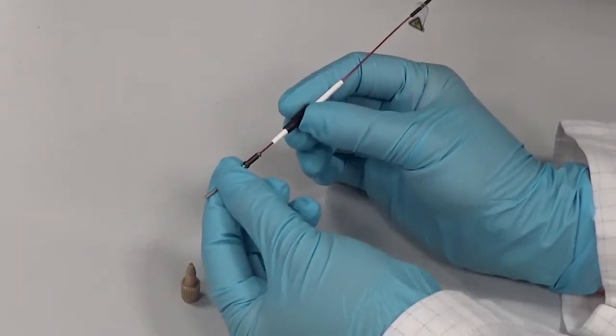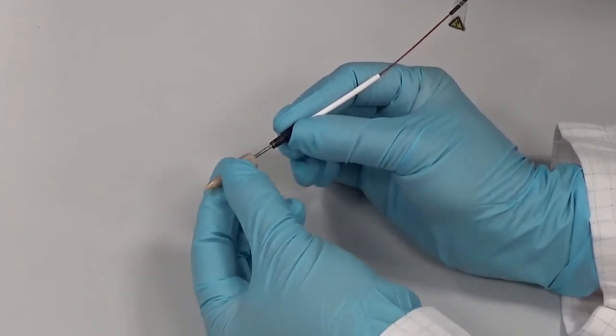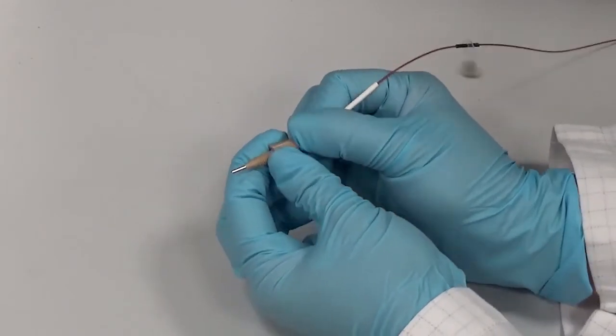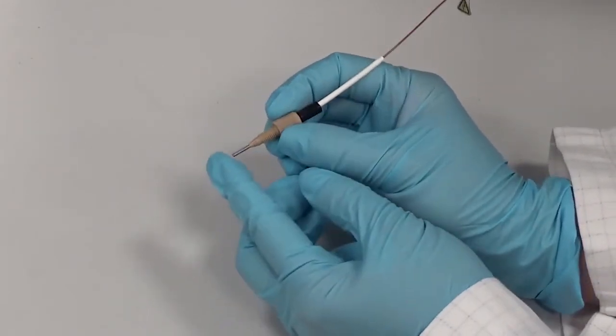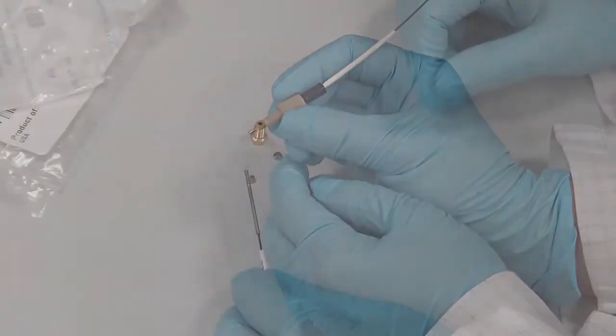The inlet fitting features a spring-loaded design to minimize dead volume at the connection to the inlet. When sliding the inlet fitting back onto the probe assembly, ensure that the spring remains fully attached to the retainer.